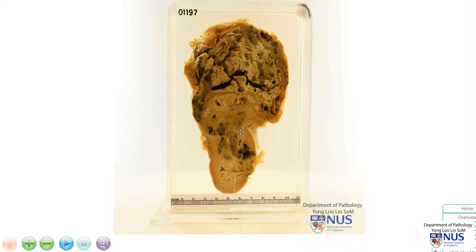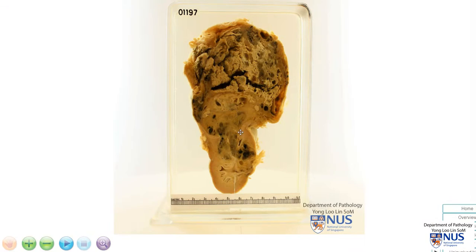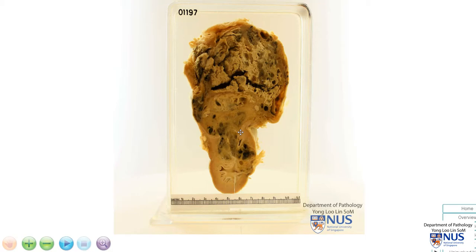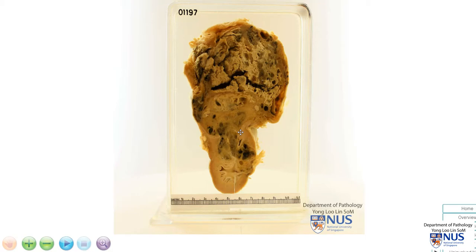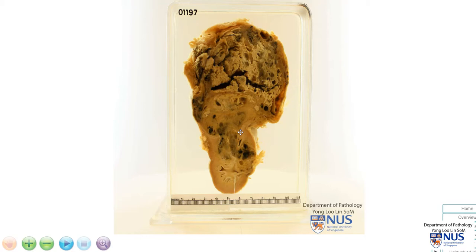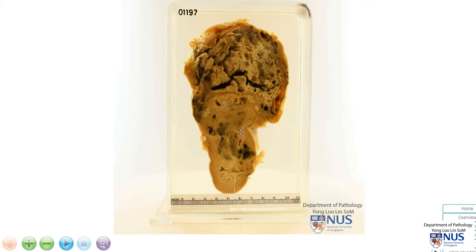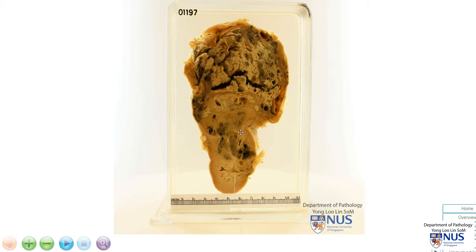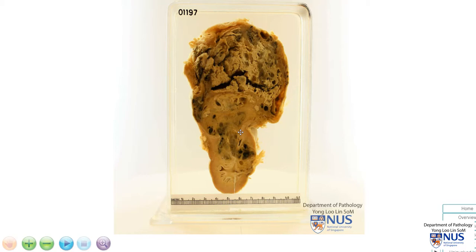Nephroblastomas usually occur in young children, typically from age zero to four. They are often very large and well-circumscribed, and there may be areas of hemorrhage and necrosis, as we see here. They may also be associated with childhood syndromes, such as WAGR syndrome or Beckwith-Wiedemann syndrome.